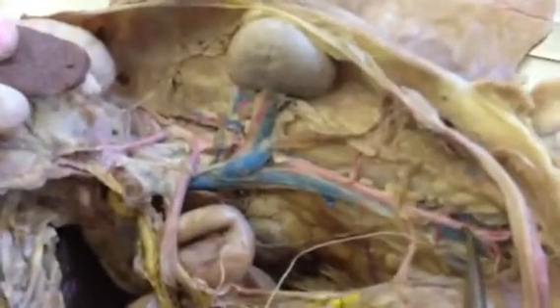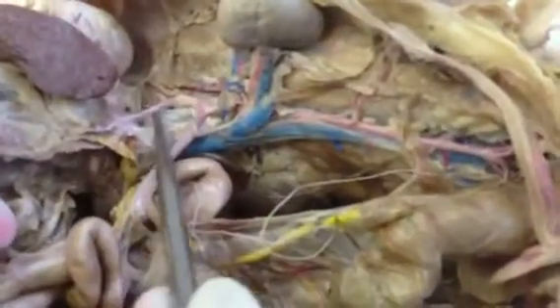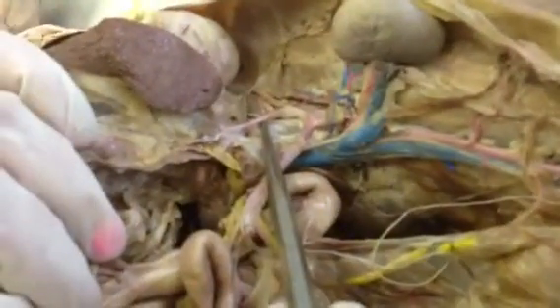All right, and then coming up here, we have the inferior vena cava, and we're going to pull all this up. Go down here, inferior vena cava continuation, and then this is the descending aorta. So I'm going to start with the arteries here. We have the celiac trunk artery.